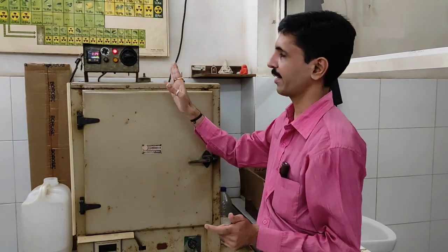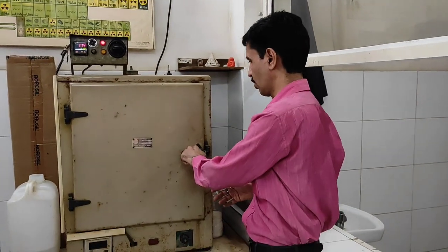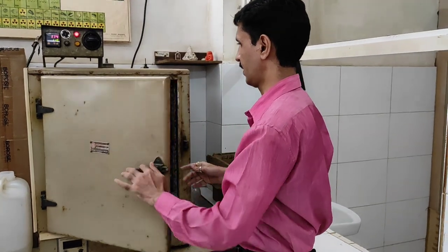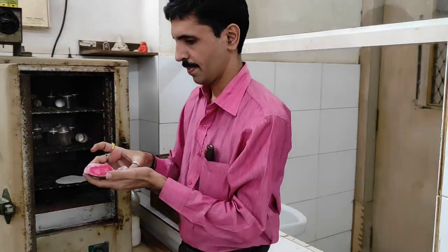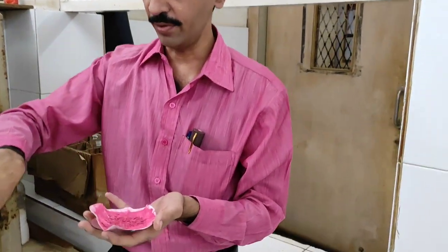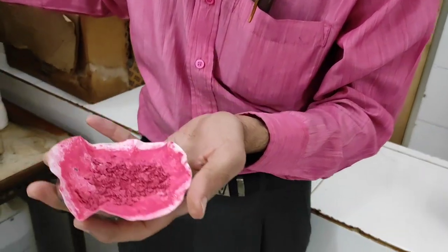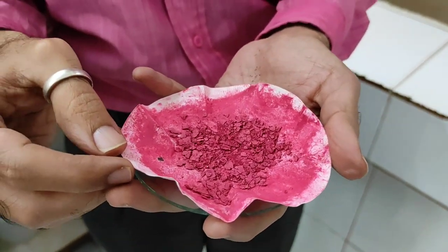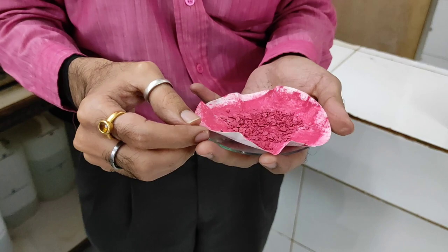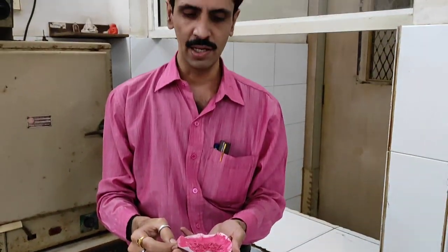Yes now, I guess 45 minutes have been done. You can check it out over here. That was the drying step which we carried out to drive away the water molecules. So let us check now whether the product is dried or not. Yes, you can see, check it out now. It's completely dried. You can see this in a powder form. After this, we will proceed for the weighing purpose which is a very important step of this particular experiment.